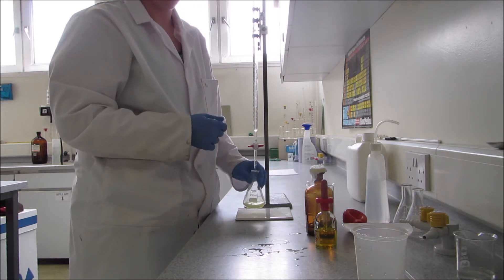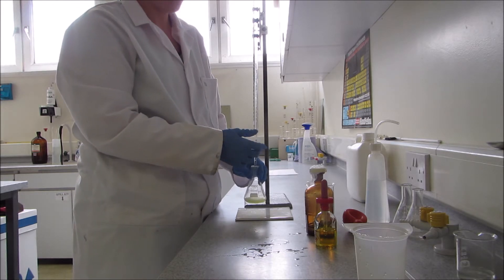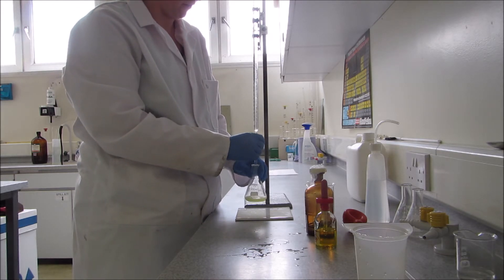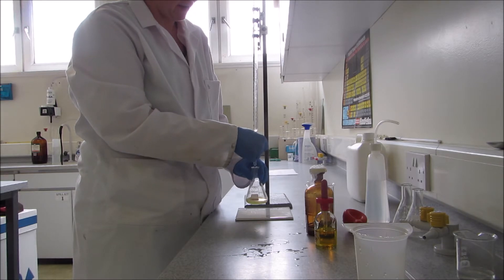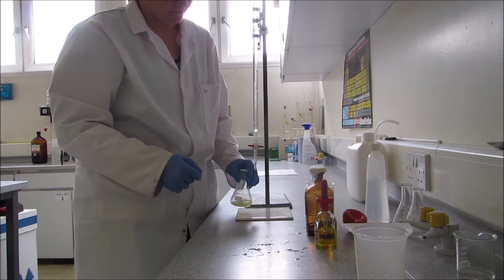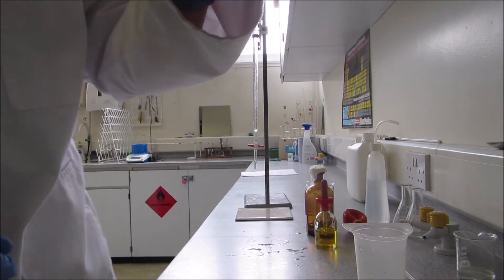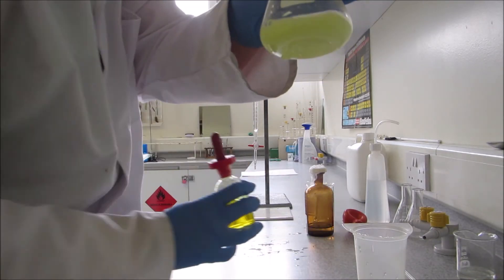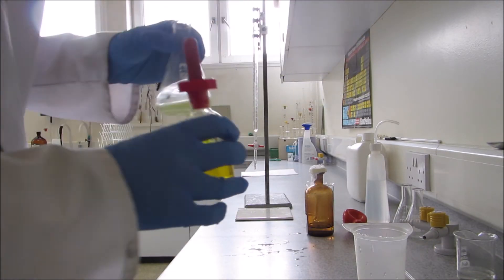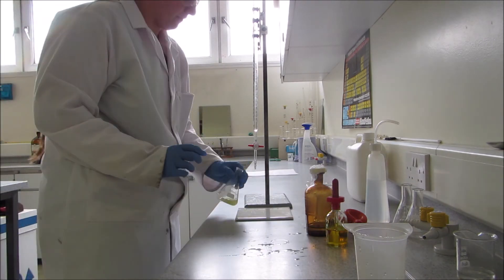Initially, your silver nitrate will react with all the sodium chloride to produce a silver chloride. That's why it's gone sort of a cloudy yellow as opposed to the starting yellow. That's a silver chloride precipitate being formed.